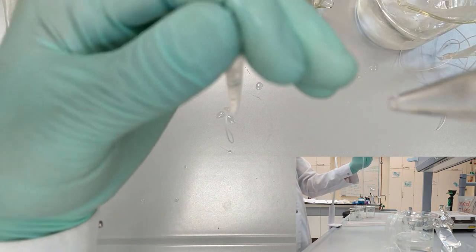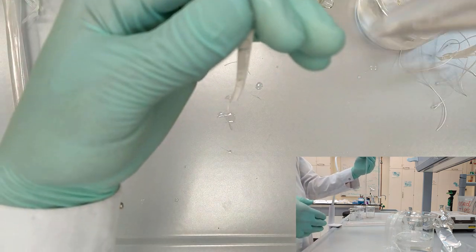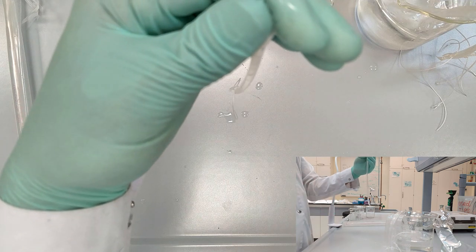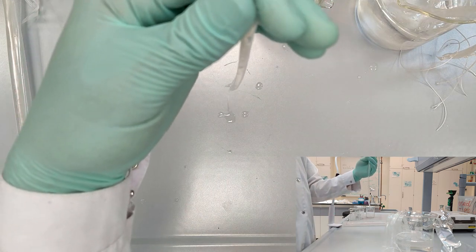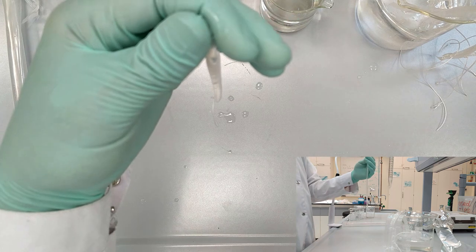After filling the tube, you will need to tie it on the other edge so nothing leaves through the holes on the edges.